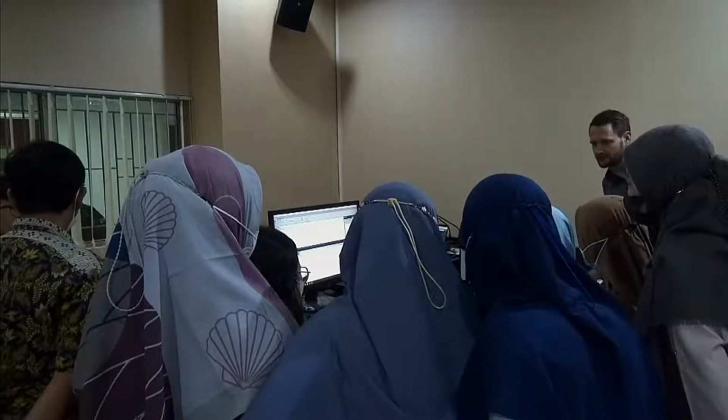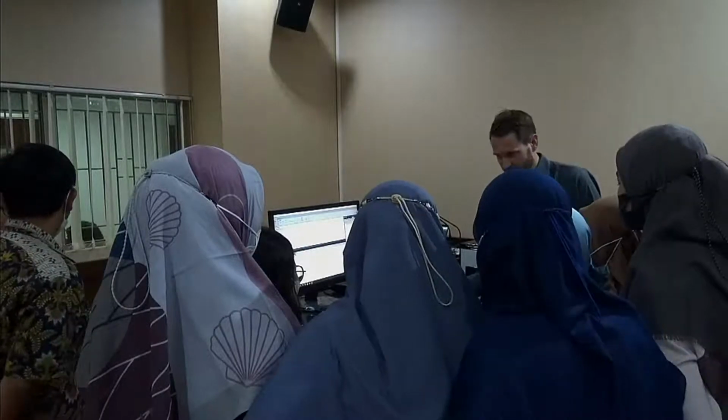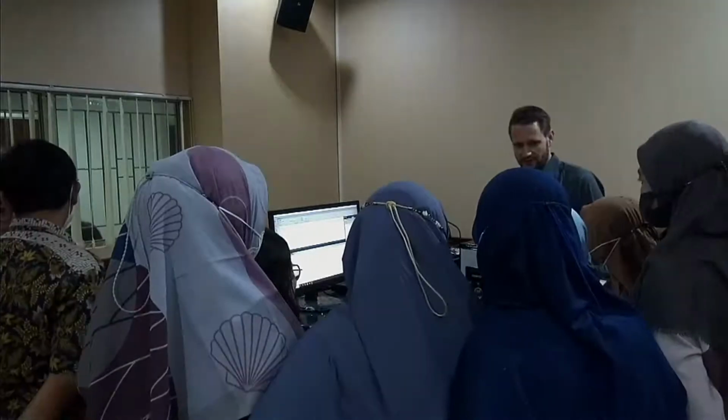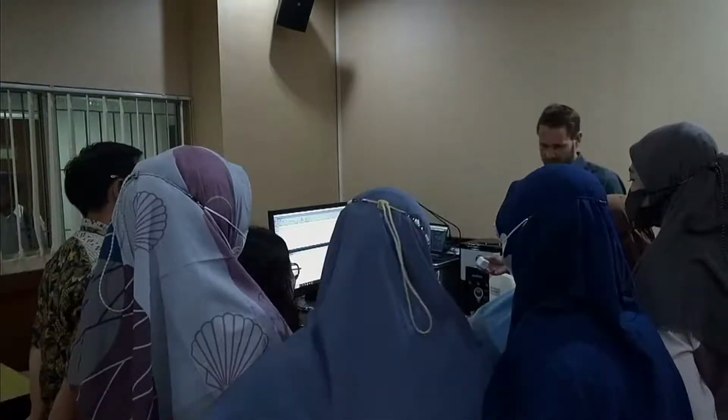So whenever you have questions about performance, you don't need to buy an expensive standard. You can use this first of all and check, does it fit with the final testing result that we achieved, or is it different? So if it fits, then the instrument is fine.